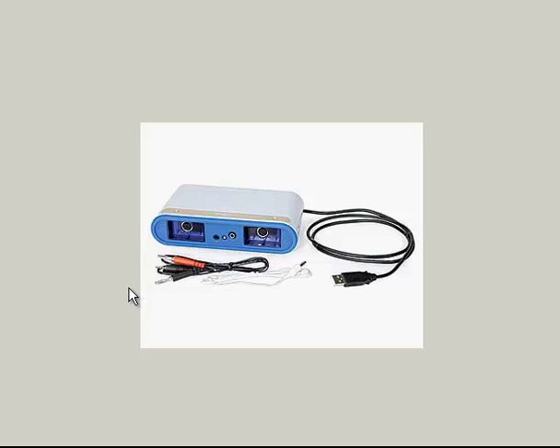There's a sensor for carbon dioxide, a sensor for oxygen, a sensor for temperature, a sensor for pH, on and on and on. So once you connect the sensor to the interface and then connect the interface to your computer, it will help record and graph and analyze data for you. So let's take a look at how we might use the computer to collect and analyze data.